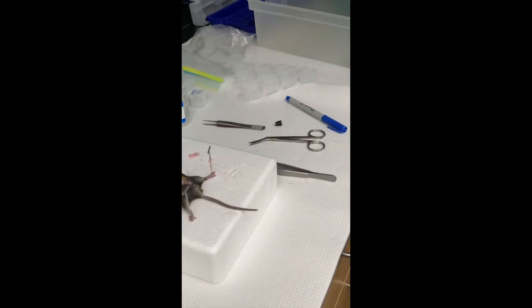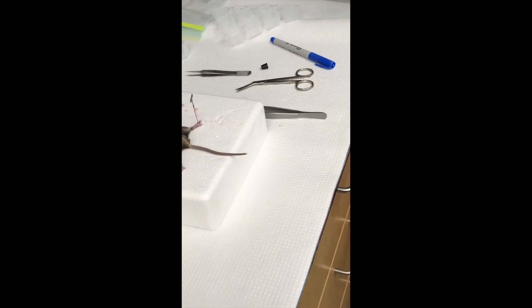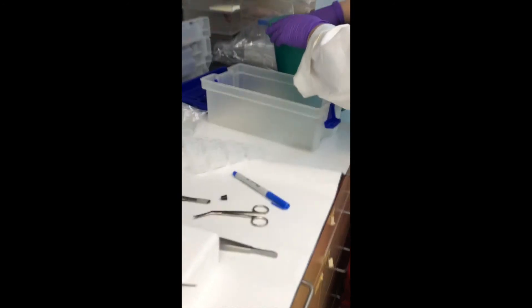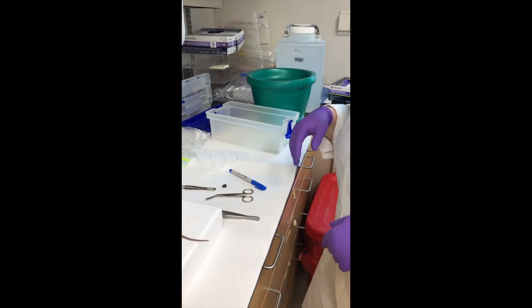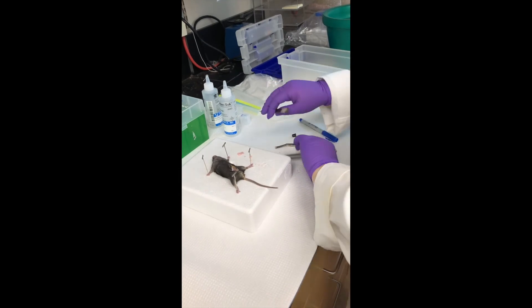And then I'm just going to put these on dry ice. Do you not have to close them up or anything? No. I'm going to leave them on there for like a half hour, and then when they're done I'm going to put them in the freezer. So now I'm going to go after the other side.